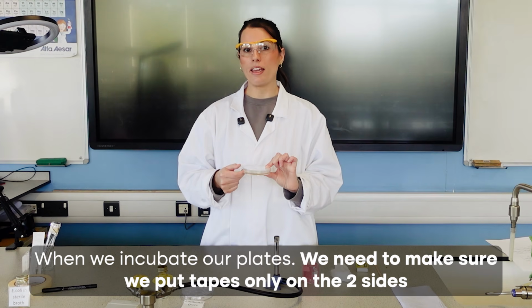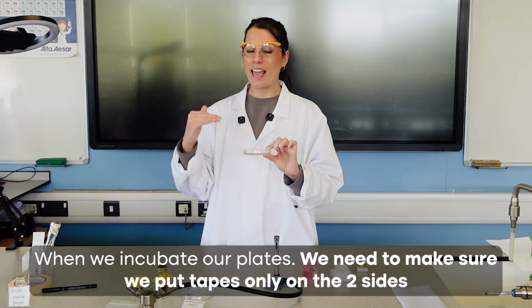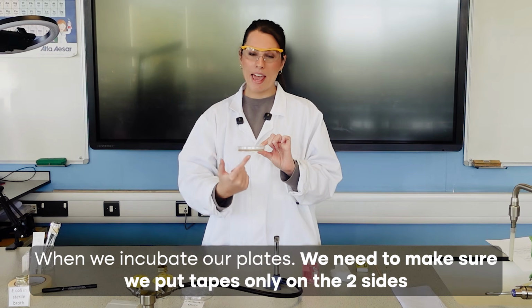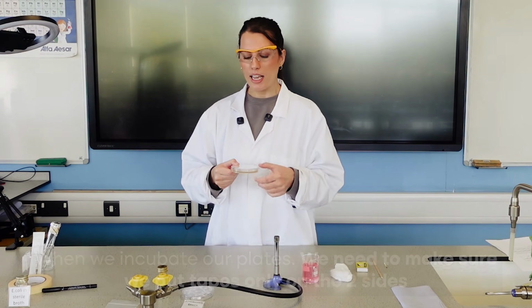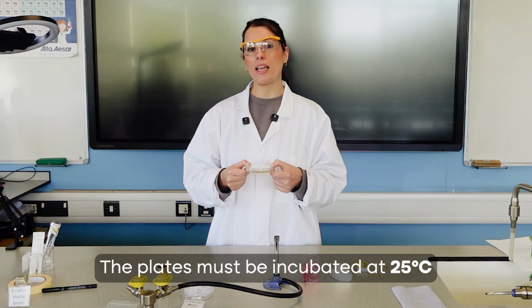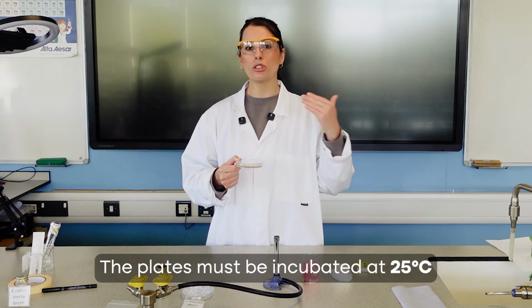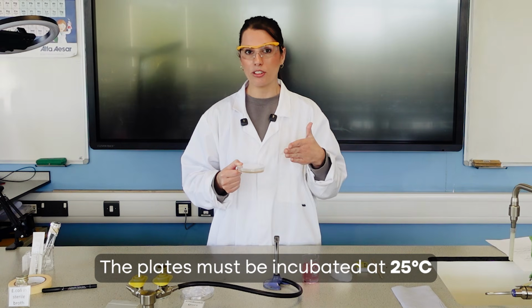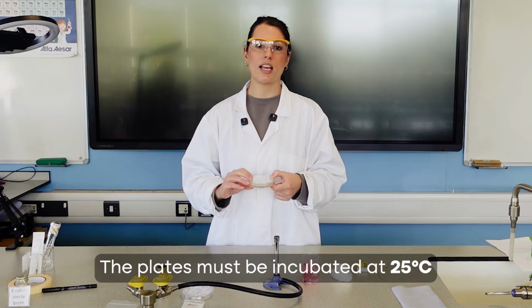When we come to incubate our plates, we need to make sure we put tape only on the two sides so that air can get in, so we have oxygen, aerobic conditions, so we don't accidentally grow any harmful anaerobic strains. And also the plates must be incubated at 25 degrees C, so it's warm enough for bacterial growth, but not so warm that we encourage excessive growth and potentially get large population sizes of pathogenic bacteria.